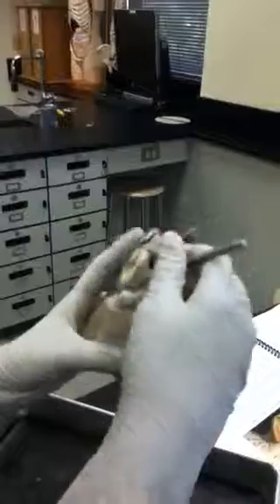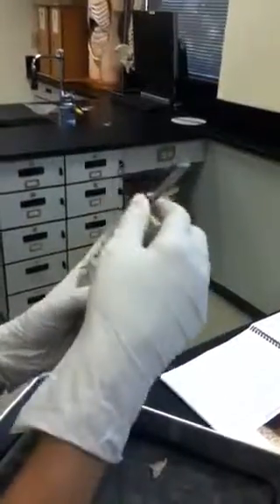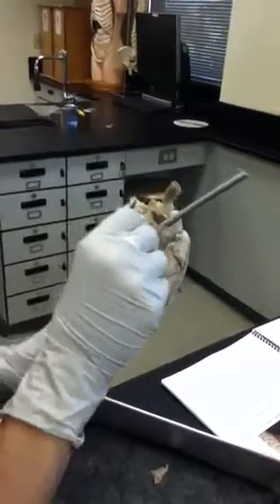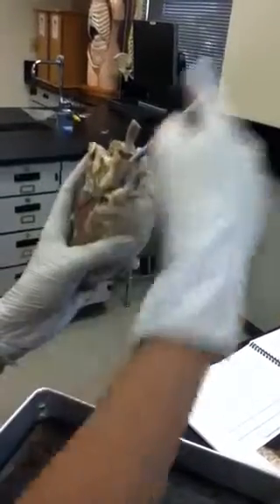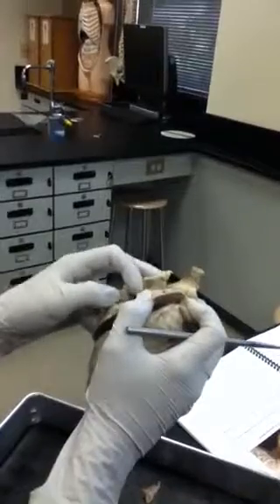When we start talking about blood flow, the right atrium receives blood flow from the body, so deoxygenated blood flow. From the upper body, it's the superior vena cava. From the inferior portion of the body, it's the inferior vena cava. And you can see you have your probe all the way through. So blood comes from the lower portion of the body, blood comes from the upper portion of the body, and it enters into the right atria. You open it up.